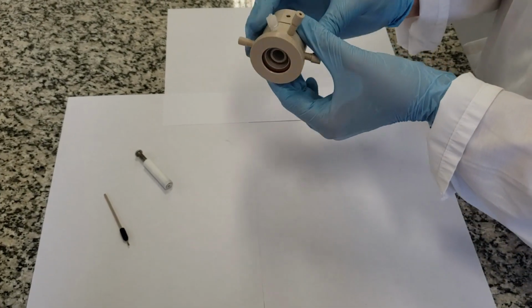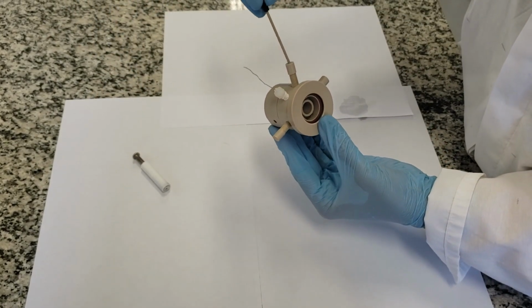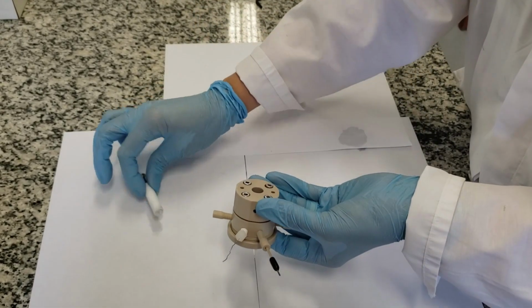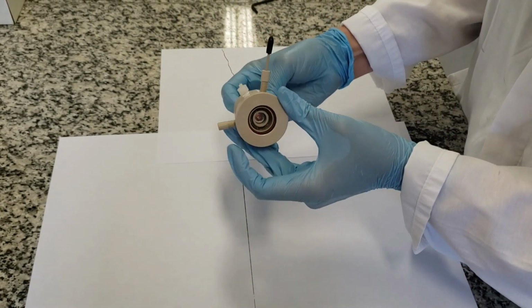Once the cell is closed, we insert the reference electrode by the side, look here, and finally the working electrode by the back. Look that the face of the electrode ends in front of the window.